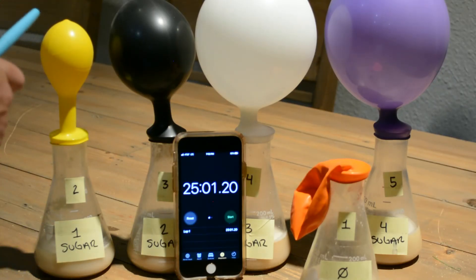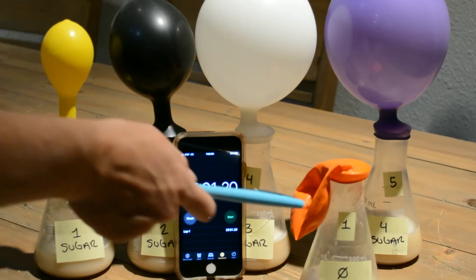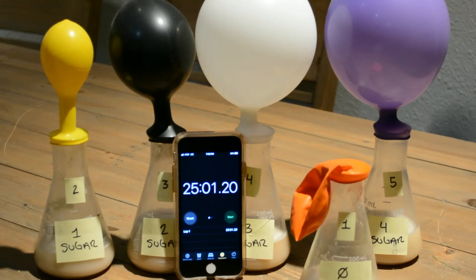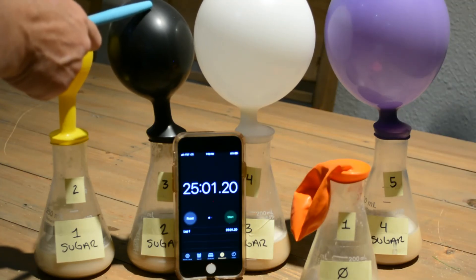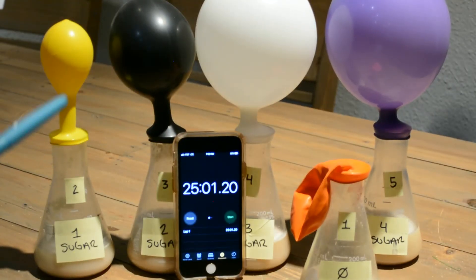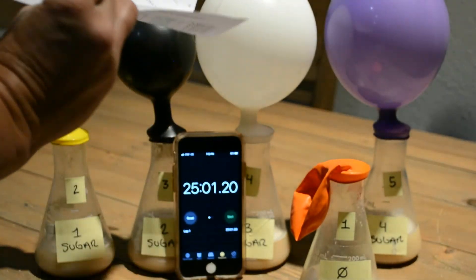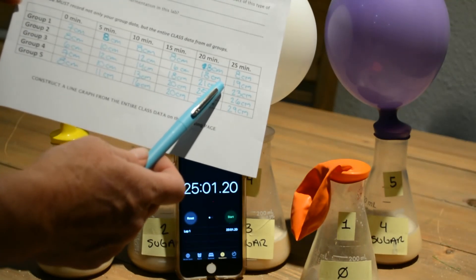Please write down that at the 25-minute mark: group one is 8 centimeters, group two is about 19 centimeters, group three is 23 centimeters, group four is 26 centimeters, and group five is the biggest at 29 centimeters. From here, take all of your data and graph it on the back — remember we are looking at consecutive time intervals.